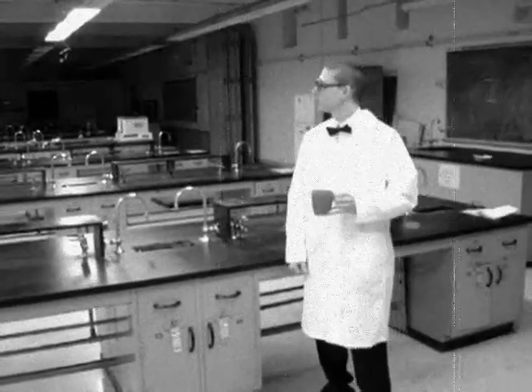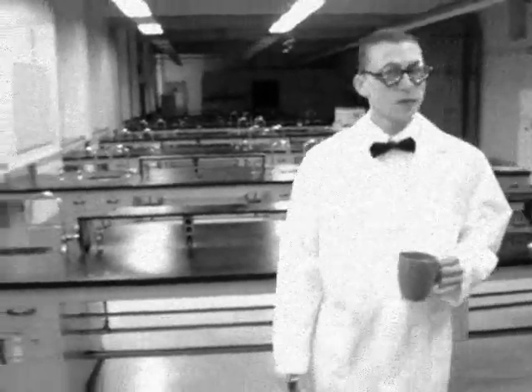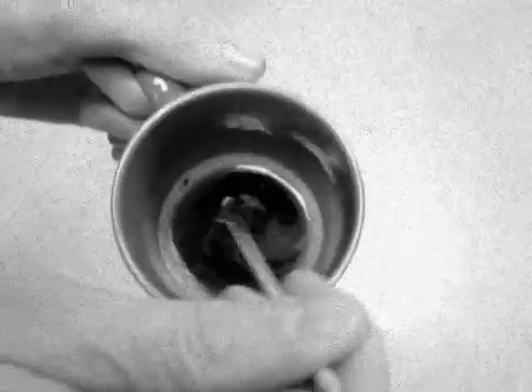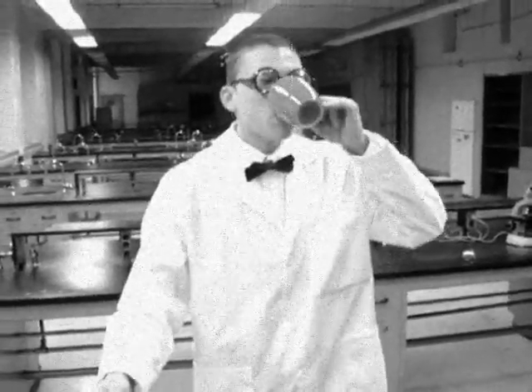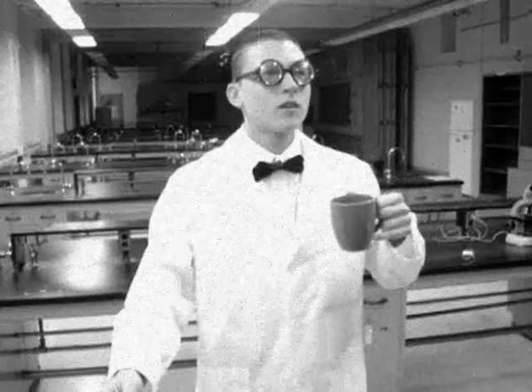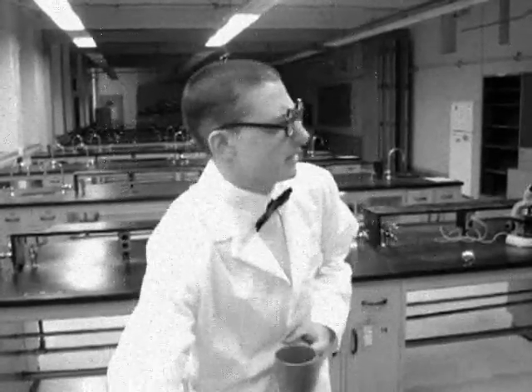Looks like Jerry found his coffee this time, but he doesn't take it black, and he can't find a stirrer anywhere. Hey, this will do just dandy, eh, Jerry? Now that's a nice cup of Joe. Looks like there were some of our little friends on there too. And they don't mind black coffee at all.